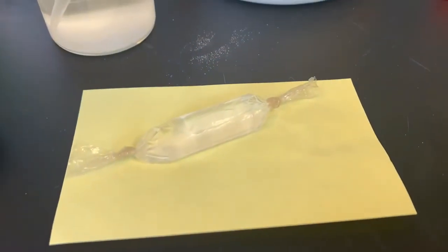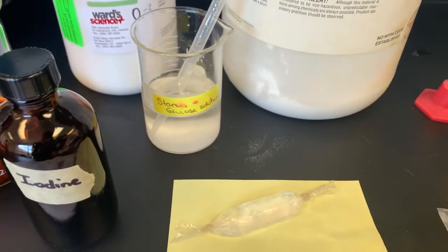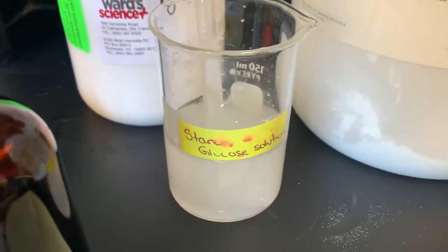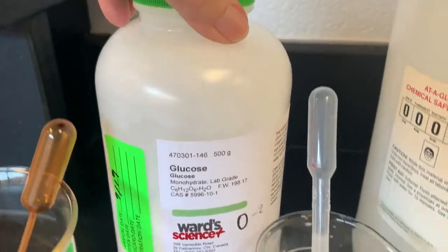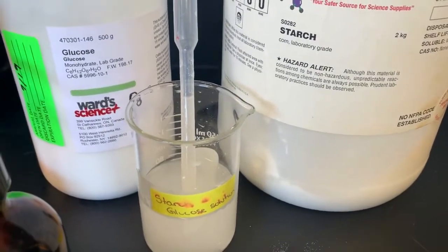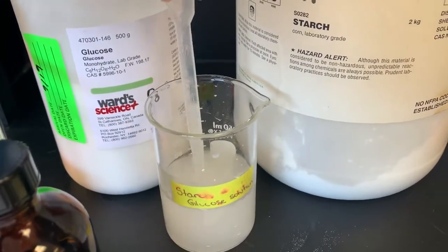This tubing is called dialysis tubing, and it has properties that allow the movement of some molecules across the membrane. And in our cell, we decided that we were going to put some solution with different molecules. So our solution that we entered in was a solution that included some water. It included some glucose, which is a simple sugar that gives us quick energy. And we also added starch, which is a complex carbohydrate that gives us longer term energy. It's a bigger molecule, so it takes longer to break down and release energy.